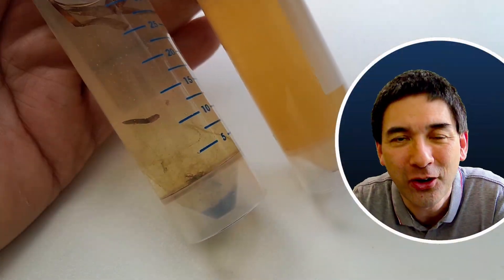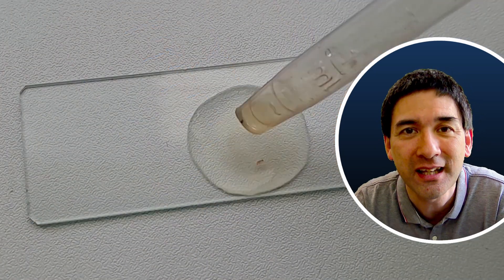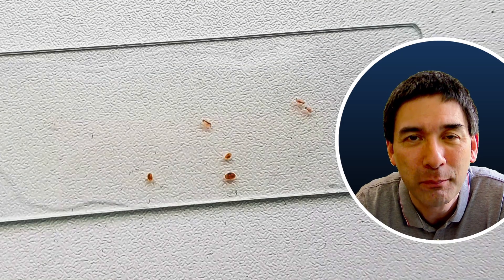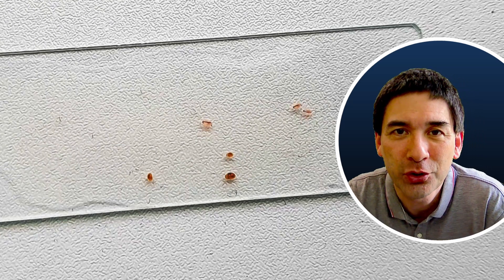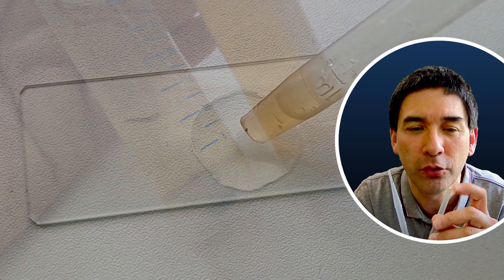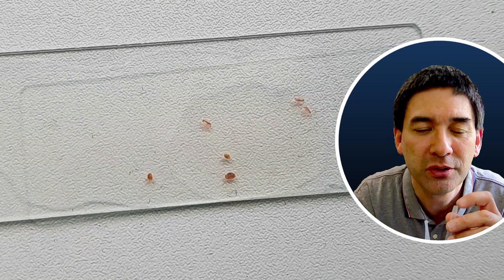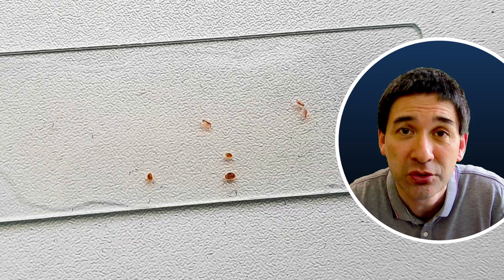Back home again — here are the two water containers, and it's already evident there is a slightly different color, because the water was different. But both of them were actually home to those water crustaceans. What I've done is used a disposable pipette where I cut off the tip, so that it's much more easily possible to suck up those crustaceans, because they have a size of approximately two to three millimeters in length.